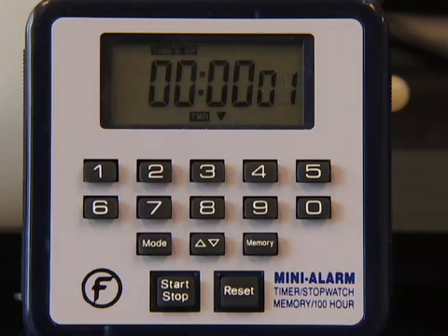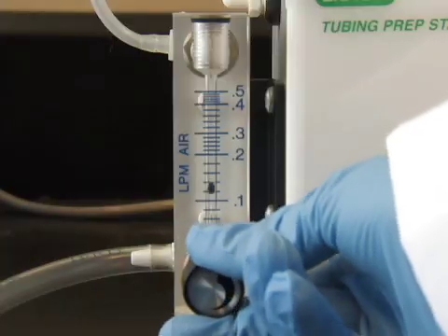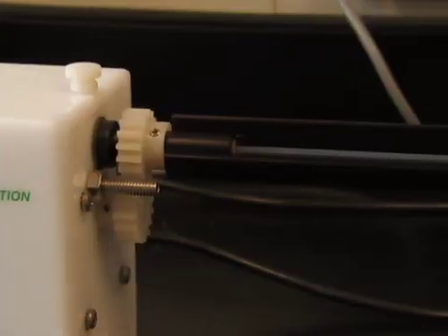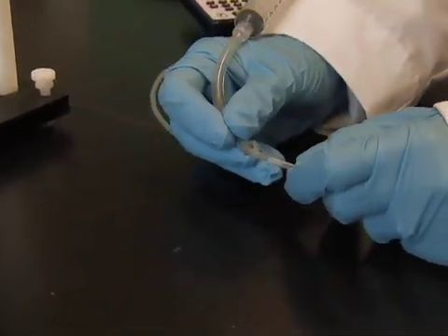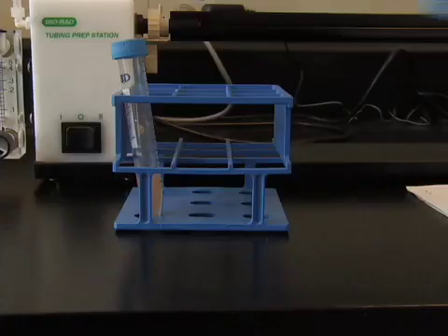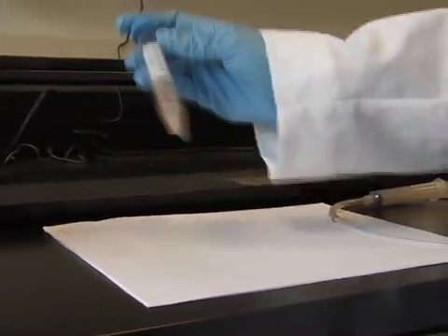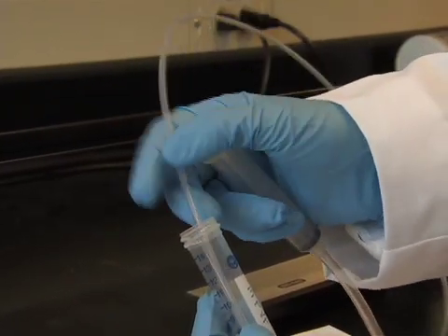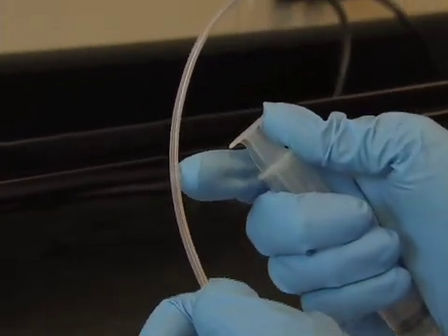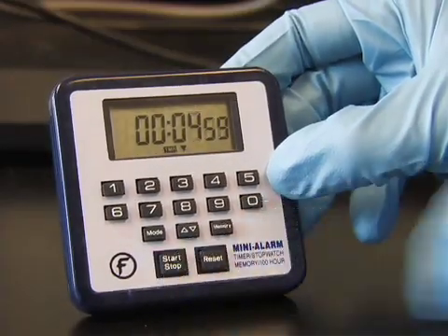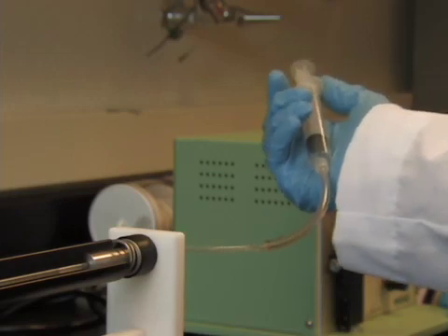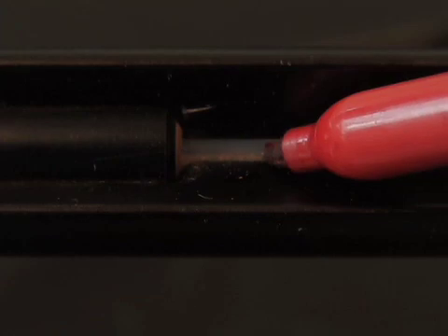Now that the tubing is dry and that the gold has been coated with the DNA, turn off the N2 station before filling the tubing with your gold PVP solution. Remove dried tubing from the station and attach to 10 ml syringe. Before sucking up the PVP and gold into the tubing, thoroughly shake up the solution and immediately suck it up into the dried tubing, avoiding bubbles. Be careful not to suck up the solution into the syringe. With the tubing now filled with the PVP gold solution, carefully place the tubing back into the N2 station. Let the solution settle for 5 minutes with the syringe attached so that the gold particles settle to the bottom of the tubing. Mark the ends of the tubing where the solution settles.